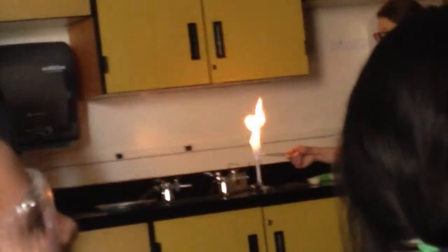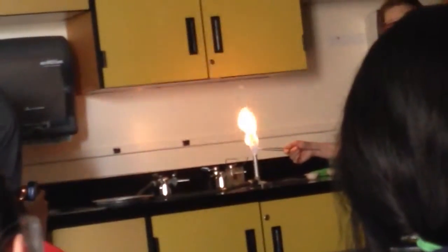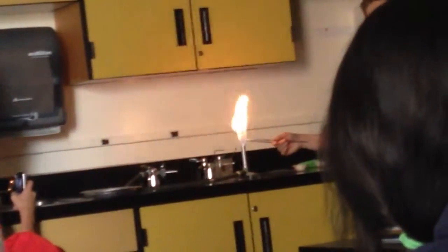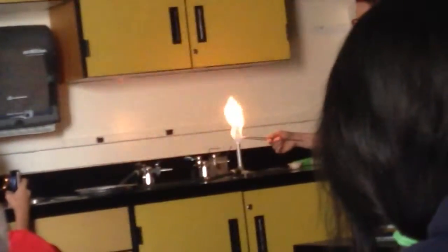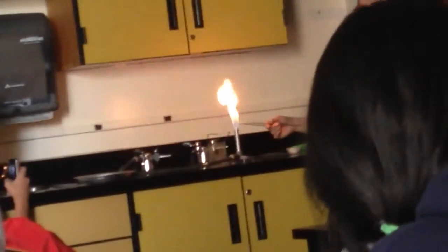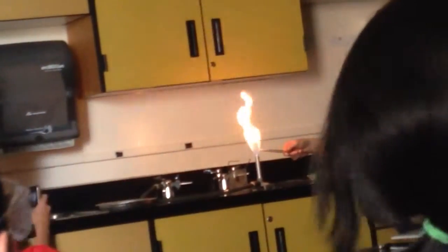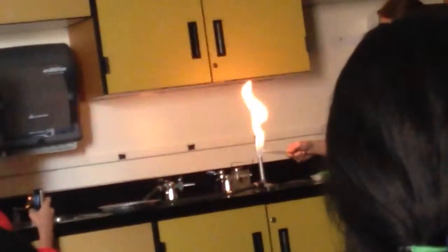What type of gas? You're exactly right — carbon. We're breathing it in. Oxygen. No oxygen, no flame, right? So now, as you start to see, I can manipulate the flame with the magnesium. It's because it's starting to have a reaction with the oxygen.